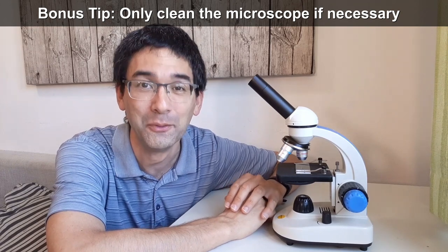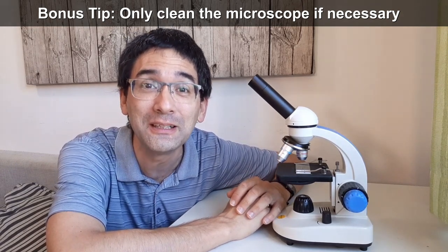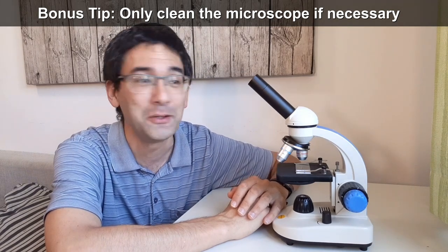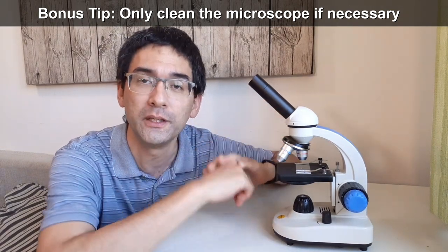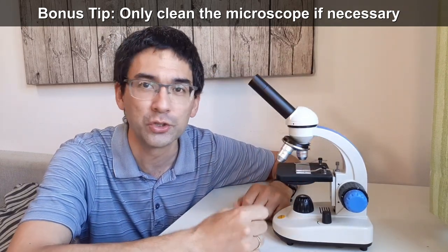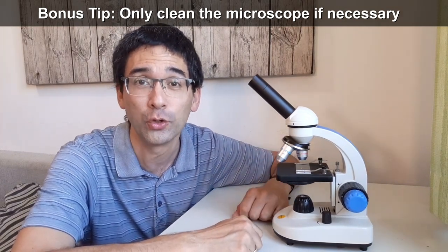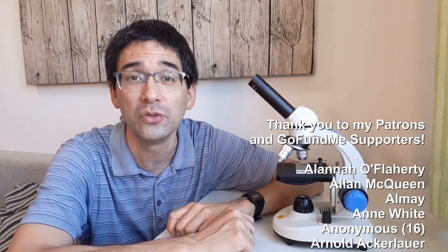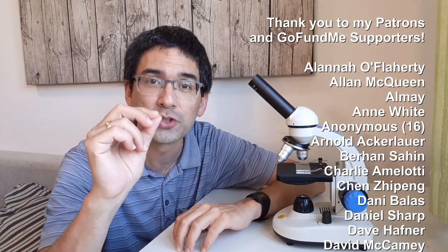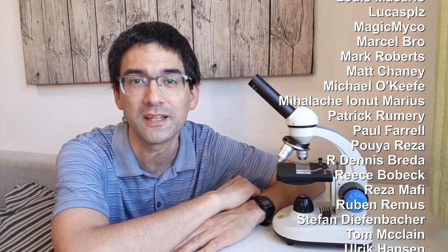And a last bonus tip, which might surprise you a little bit. If possible, don't clean your microscope. Because especially those objectives, if you keep the microscope in a reasonably dust free environment and if you put a cover over it, there shouldn't be any need to clean the microscope objectives. And as a matter of fact, every cleaning that you do risks damaging the objectives. Sometimes it might be necessary to clean the eyepiece because it might get dirty because of the eyelashes and the oil from your skin.